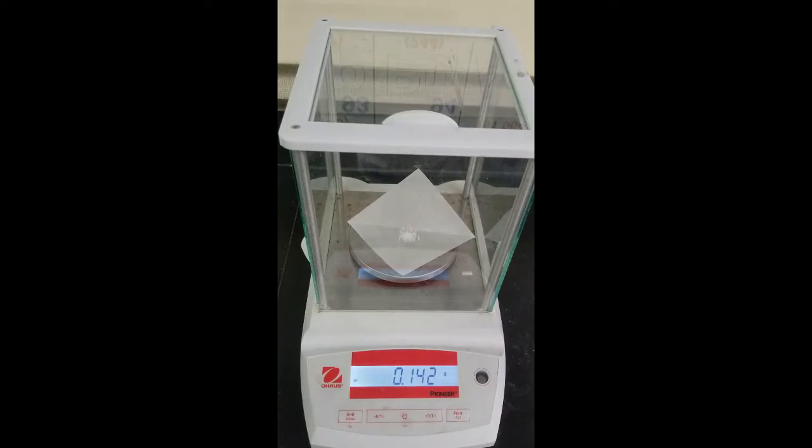There's how much we'll add for our second trial.